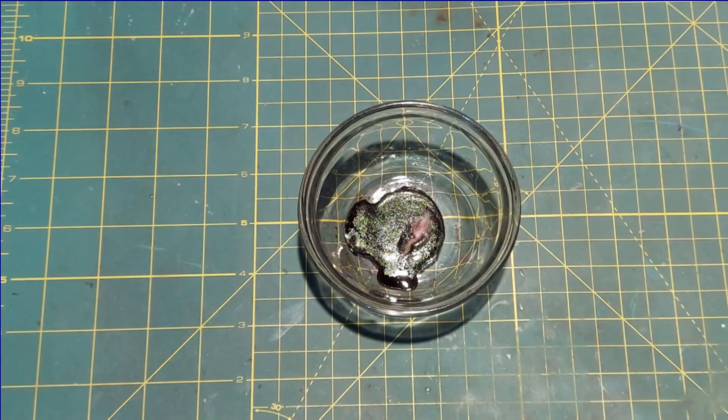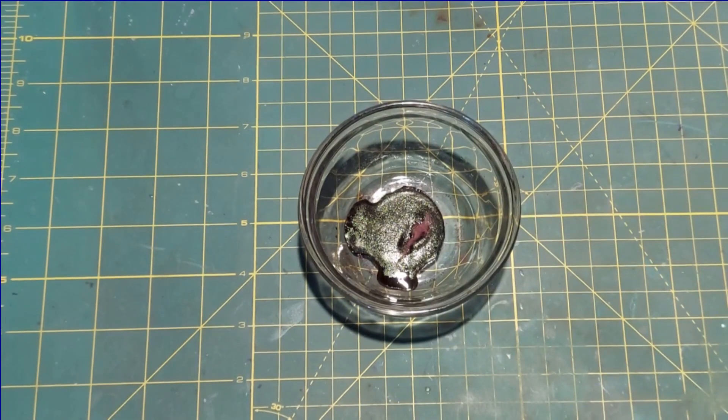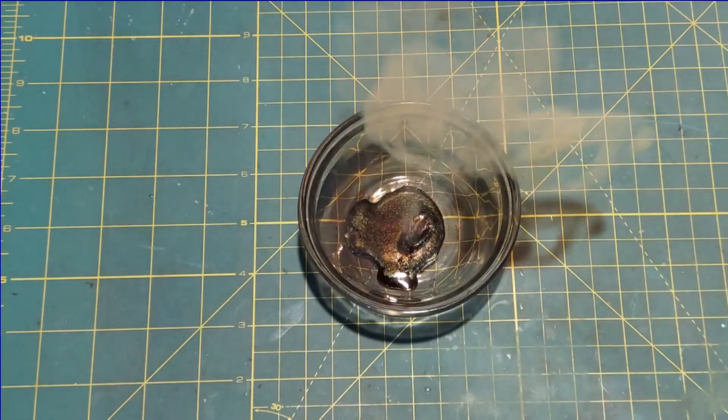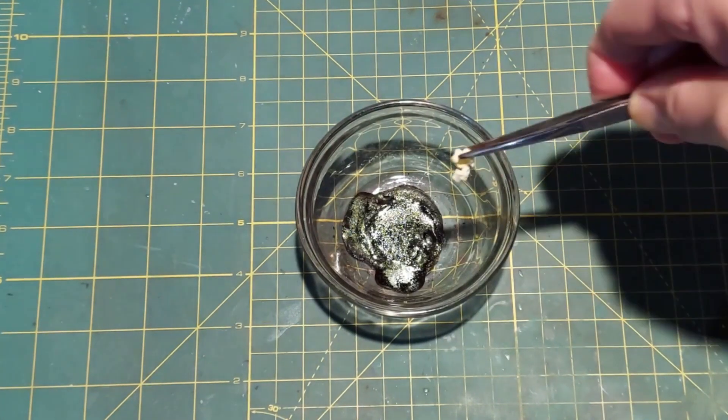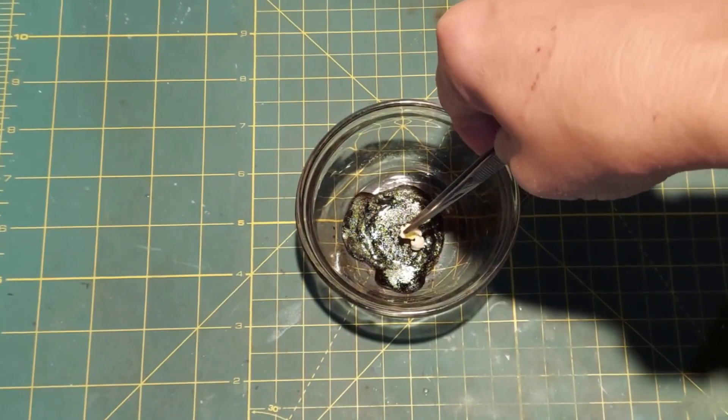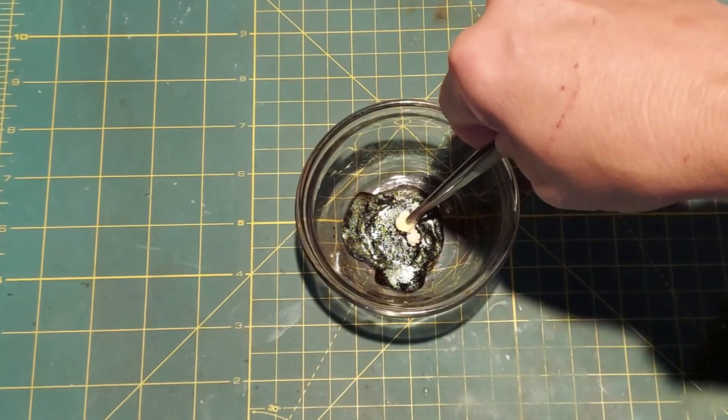All right. There goes our piece of cotton. Next we'll put in a piece of popcorn.